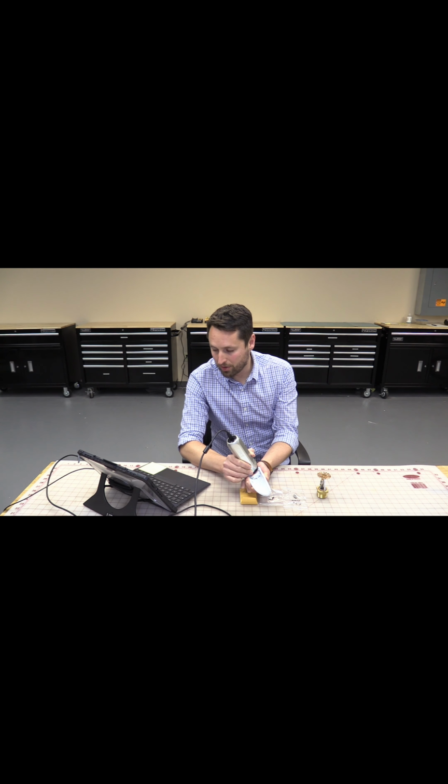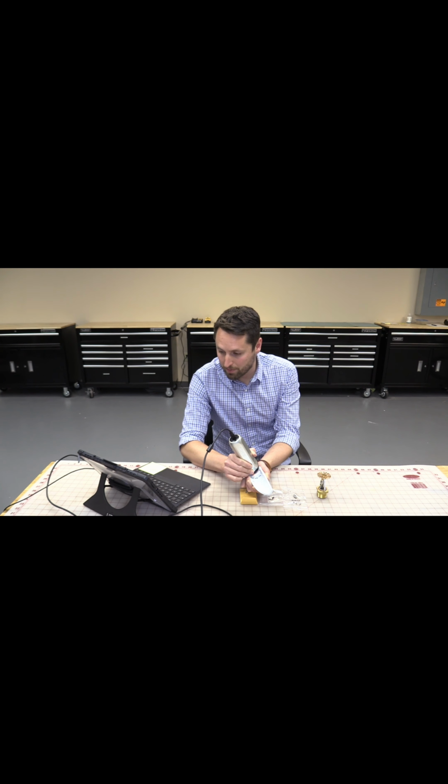You can see that on the right side of the screen, our radiating lines are pointing to the left. On the left side of the screen, they're pointed to the right. And then right in the middle there, you can see that they actually angle upward. That is our origin. So we're able to confirm our specific origin in this case is coming from this area where we have some more ductility.